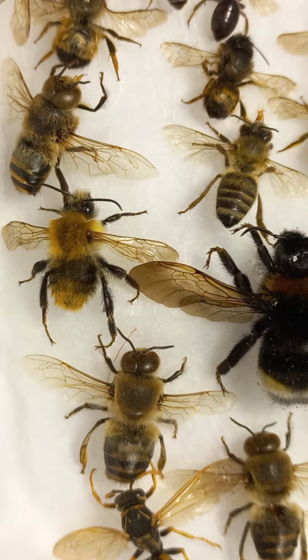Let's talk about the structures on the head of a honeybee. These are antennae, which are located on the head. There are 5 eyes: 2 facet eyes and 3 simple eyes. Then the tongue, which is the proboscis, and the jaws, which are mandibles. The proboscis is for lapping and for sucking liquids such as water, nectar, and honey. And the jaws, or mandibles, are used for chewing pollen, and in the case of workers, shaping the beeswax.